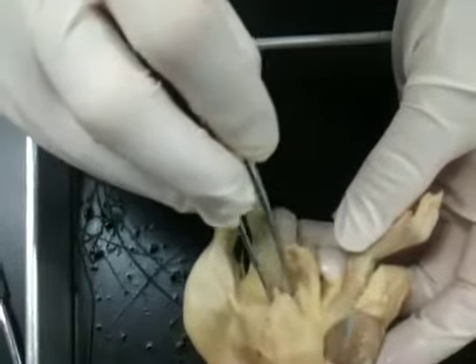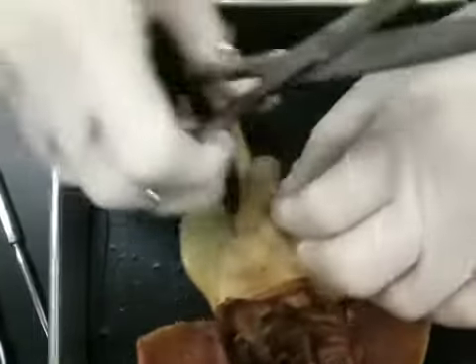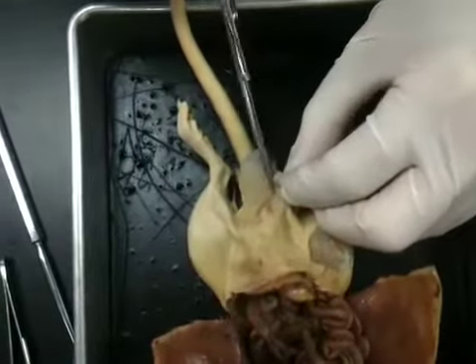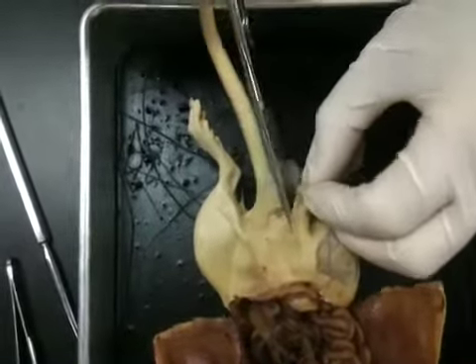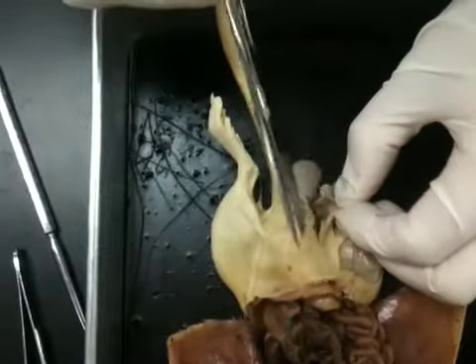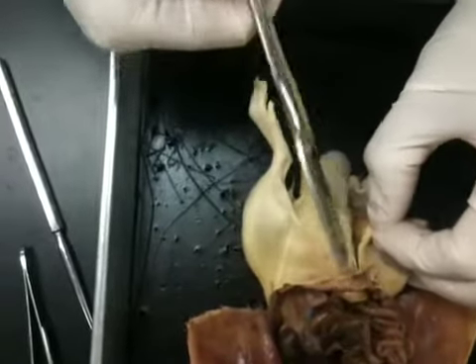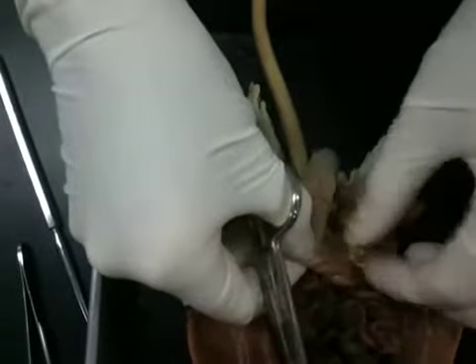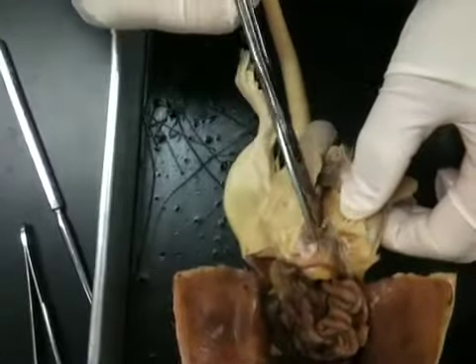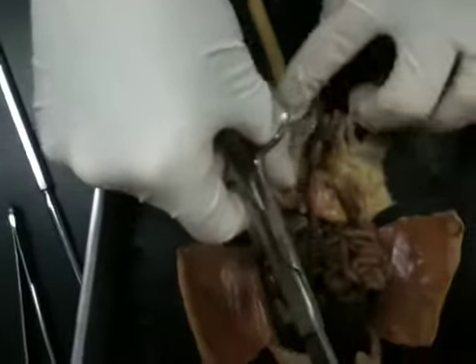So we'll have to expose the penis right there. So in order to do that, rounded side down, we're going to, gentlemen, take a deep breath. It's okay. We're going to take the middle of the scrotum. We're going to snip that. And we're going to open that sac up. Remember to pull up on your scissors so that you don't cut through anything else that you don't want to. We're going to lay that open a little bit, and you can still see some of that mesentery. So I need to make sure I cut through that a little bit. And now we can lay that open and take a look.